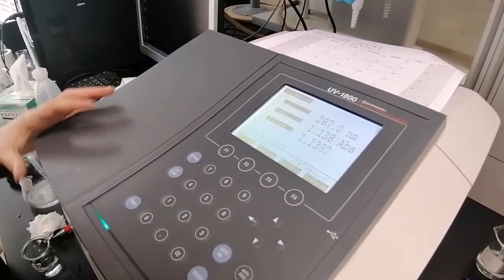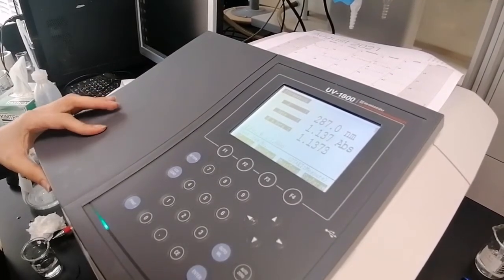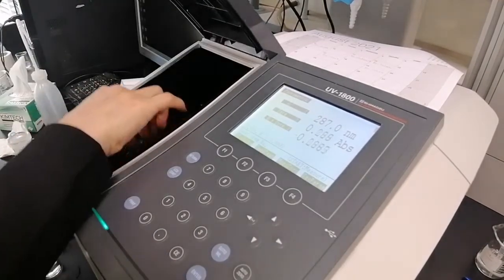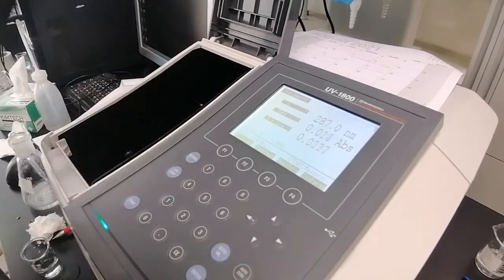the main problem will be with pH 8.2. We mainly will need dilutions with sodium hydroxide here. We will test it first.